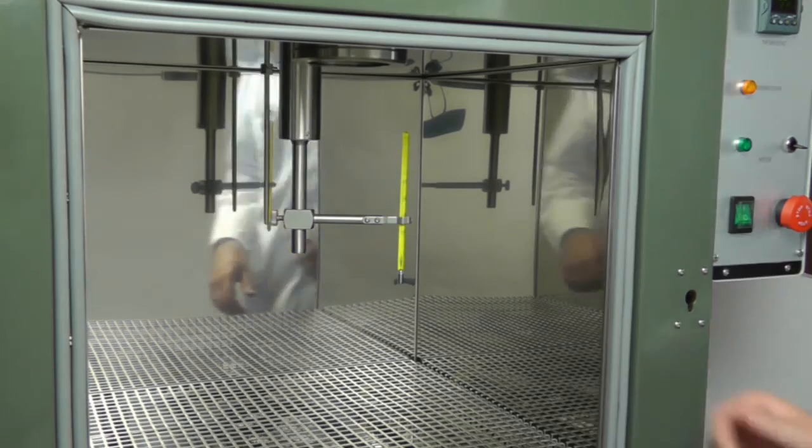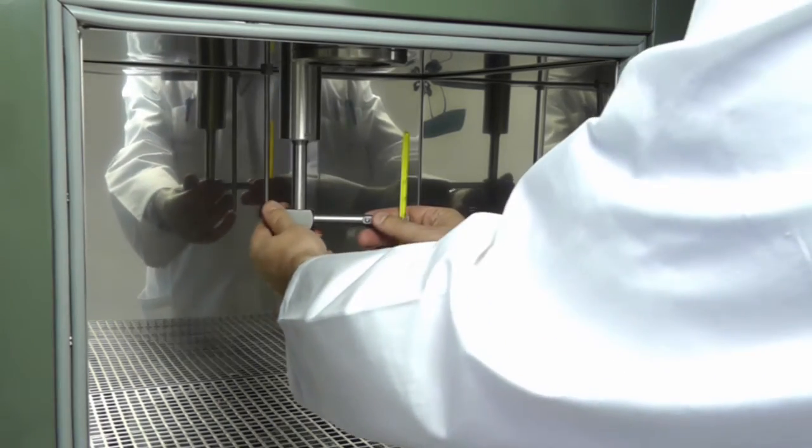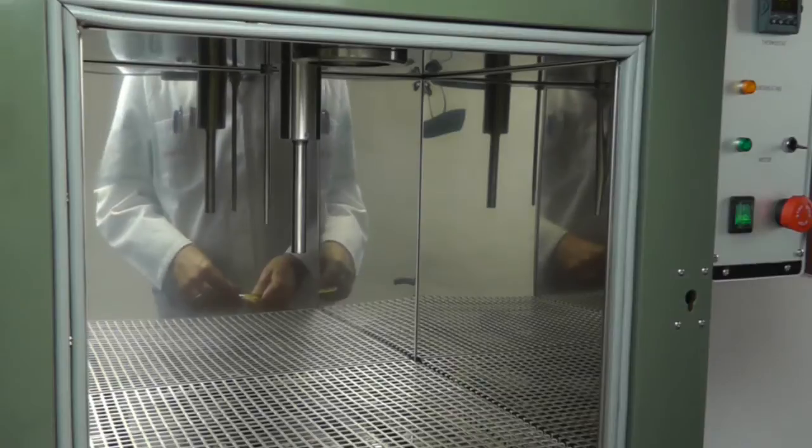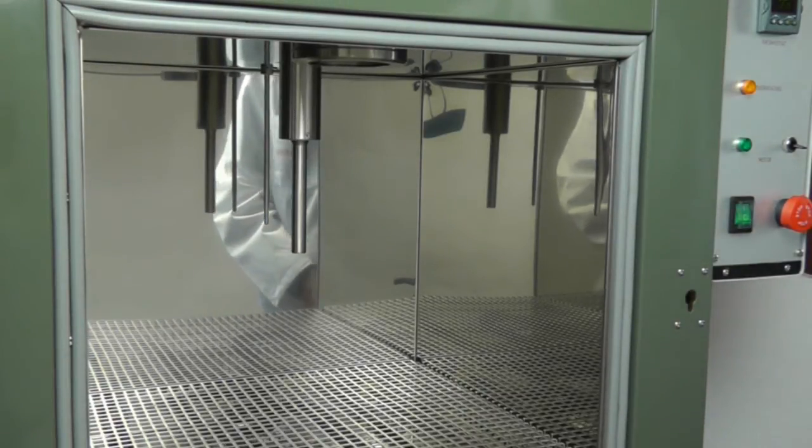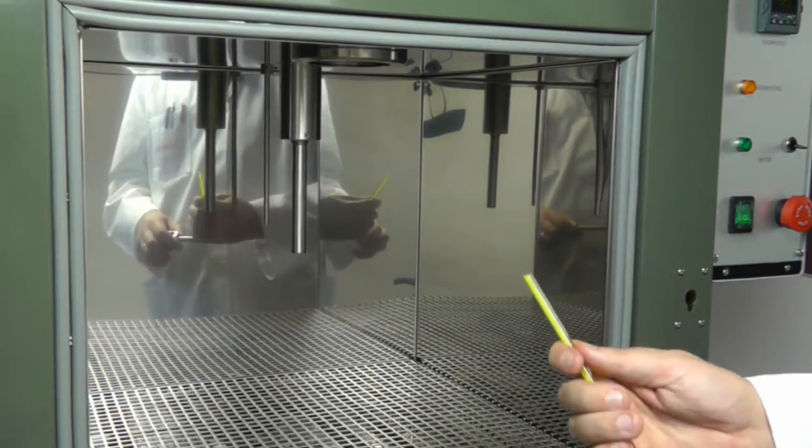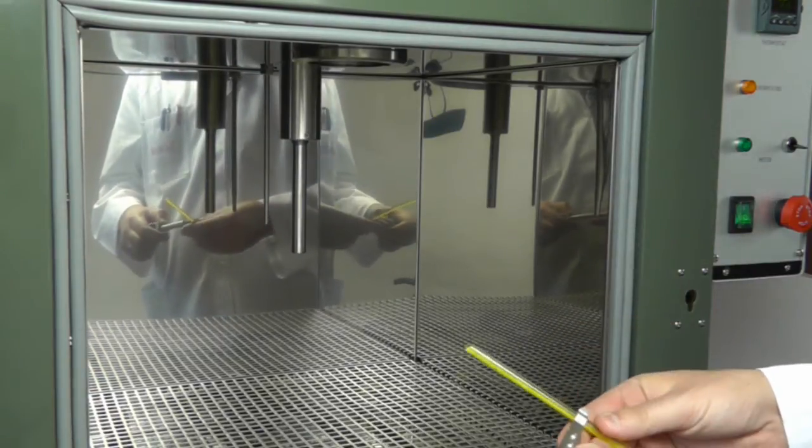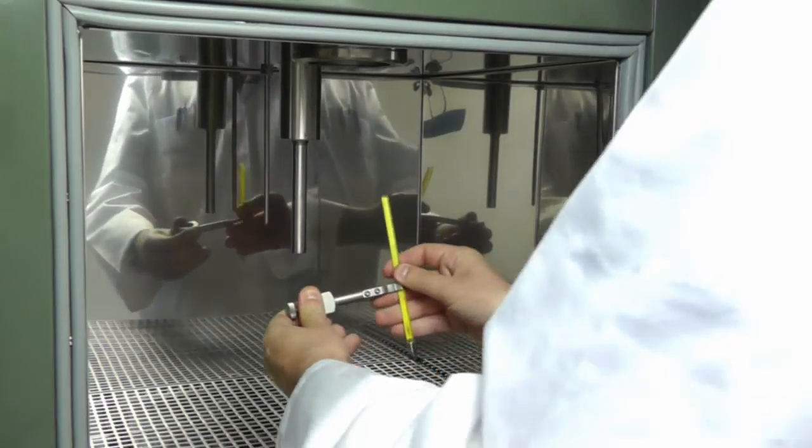We have to change also the thermometer support because ASTM D1754 requires a different distance from the center. So there is a dedicated thermometer support.